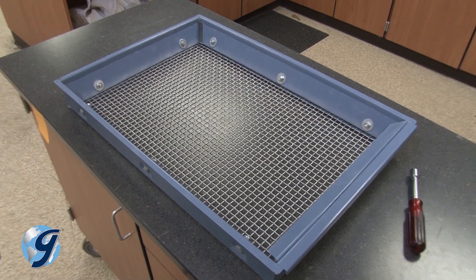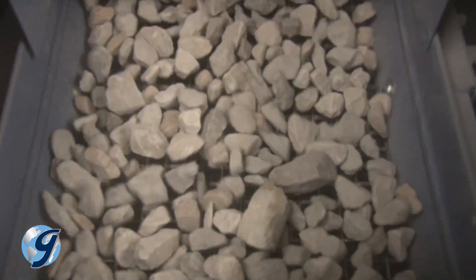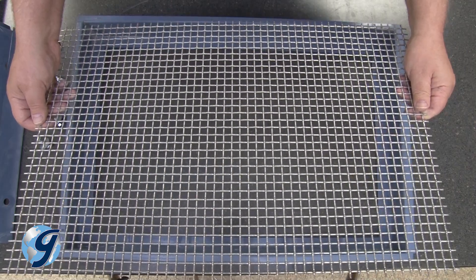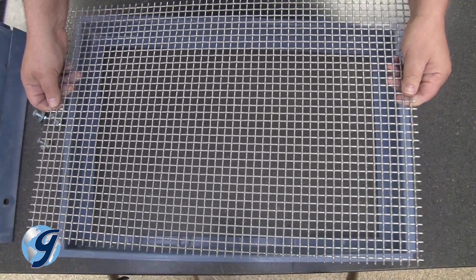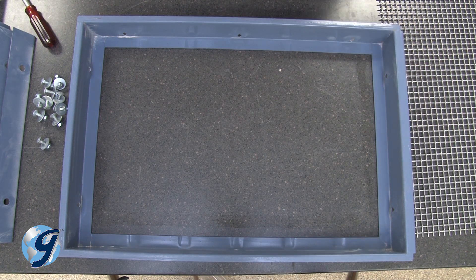These precision made meshes should be treated with care. Slight variations in mesh openings due to normal use or improper cleaning and handling can cause the wire cloth to be out of specification. It's important to check your screen tray wire cloth. If the mesh is worn, loose, or damaged, discontinue use until the wire cloth can be replaced.